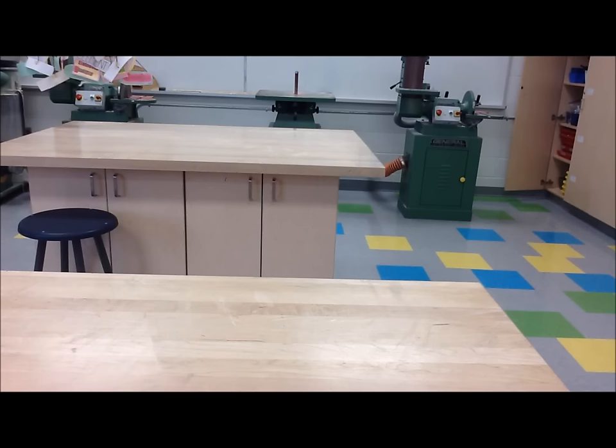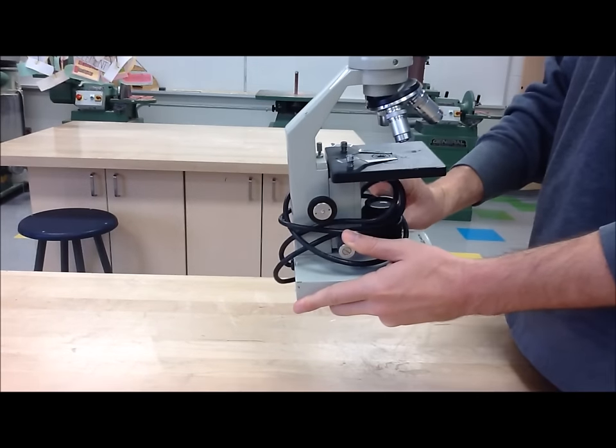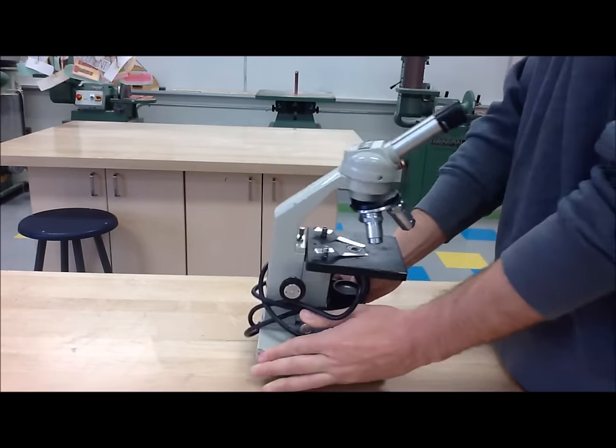Ready to go? Okay. Hi, Dr. Science Hands. Step 1: Always carry the microscope with two hands.